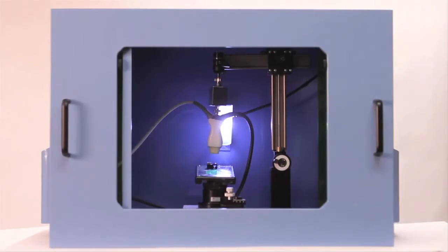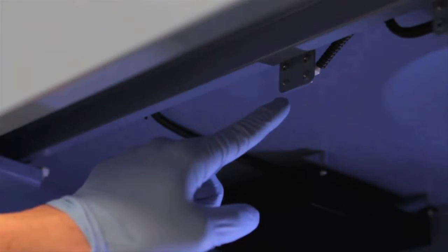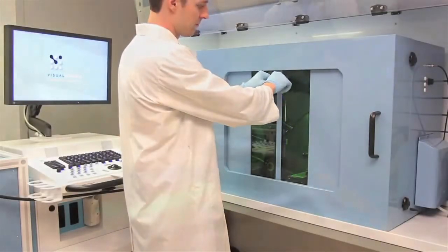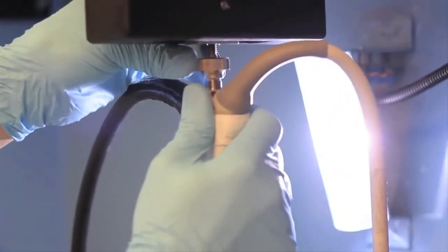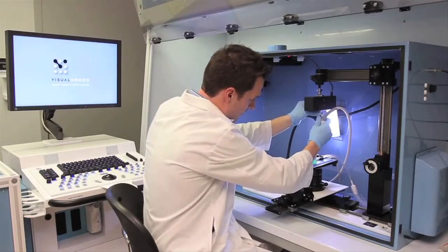Furthermore, containment of the laser light is achieved with extensive interlock circuitry, an essential requirement for operator safety and particularly important for shared use facilities. The integrated fiber optic linear array transducer generates the images and contains 256 elements for ultrasound detection and a light source for emitting laser pulses.